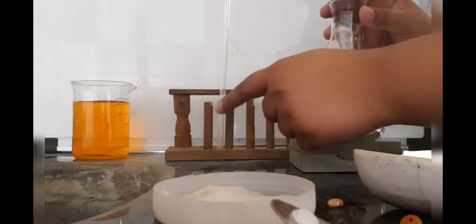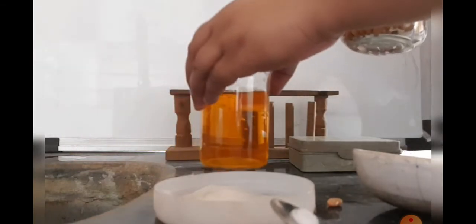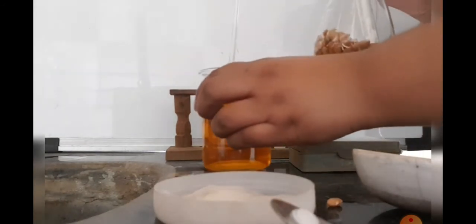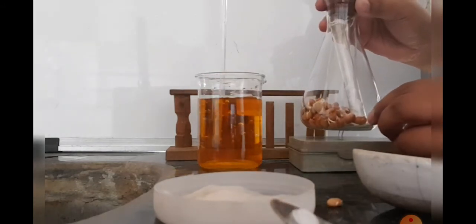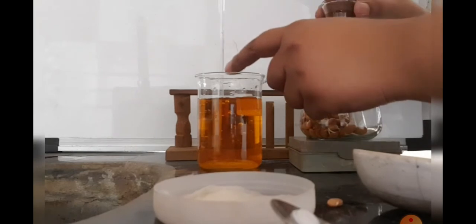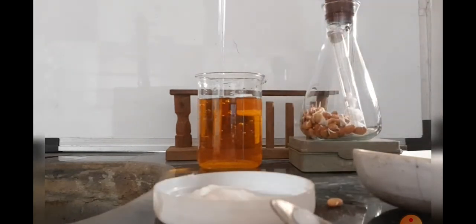The larger end of the bent tube we insert into a beaker. Here in this beaker we have colored water. We took colored water so that we can easily mark the water level in the bent tube, as we need to measure the water level in the bent tube.